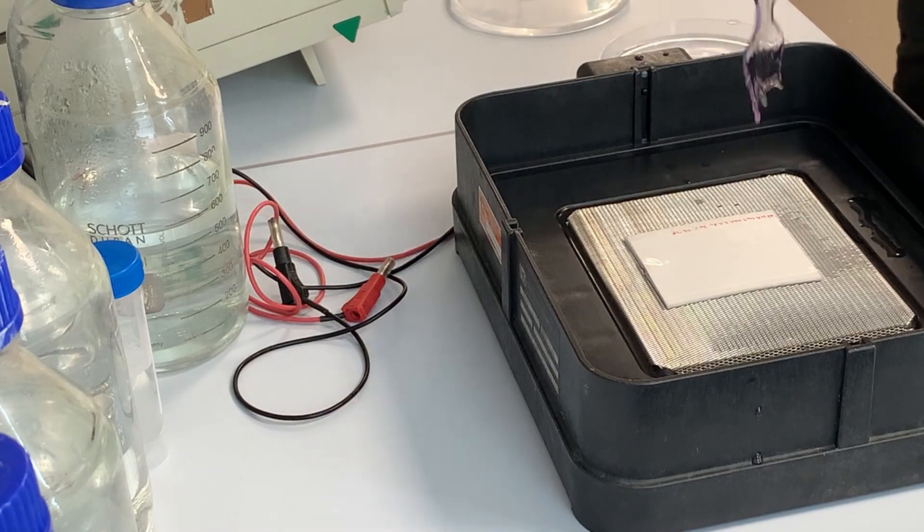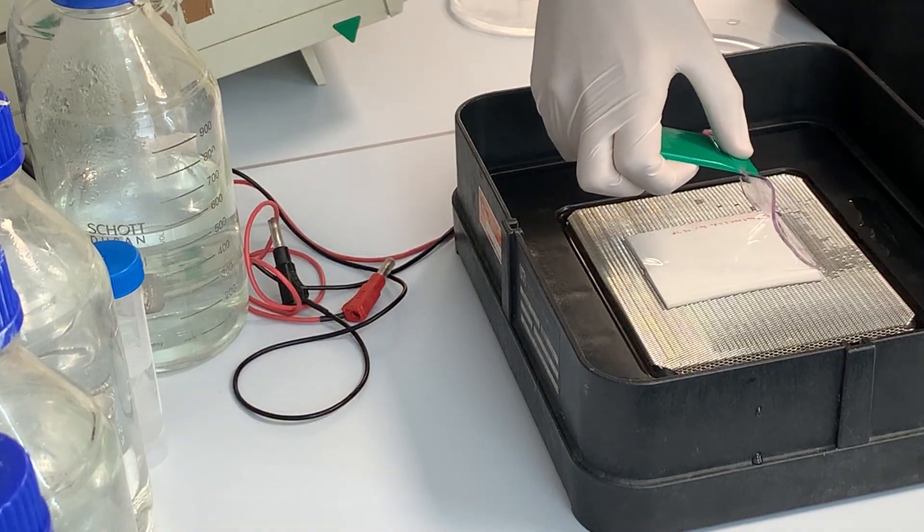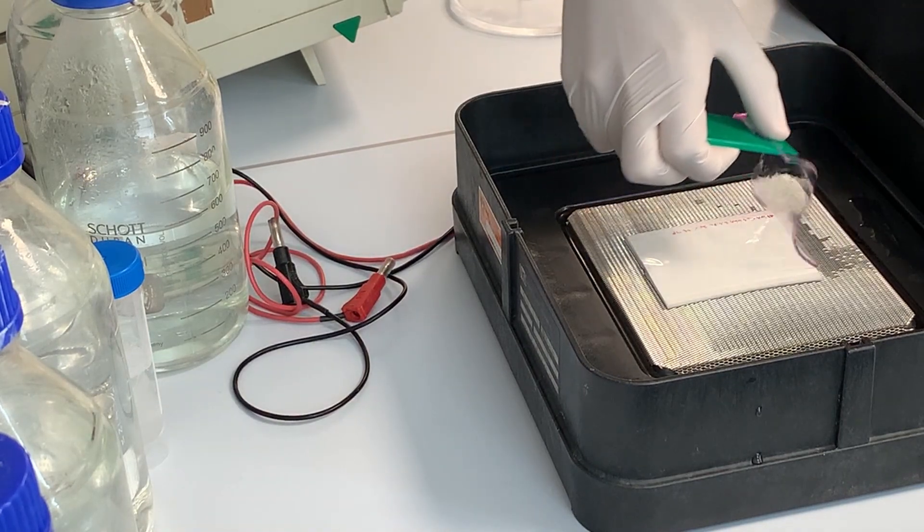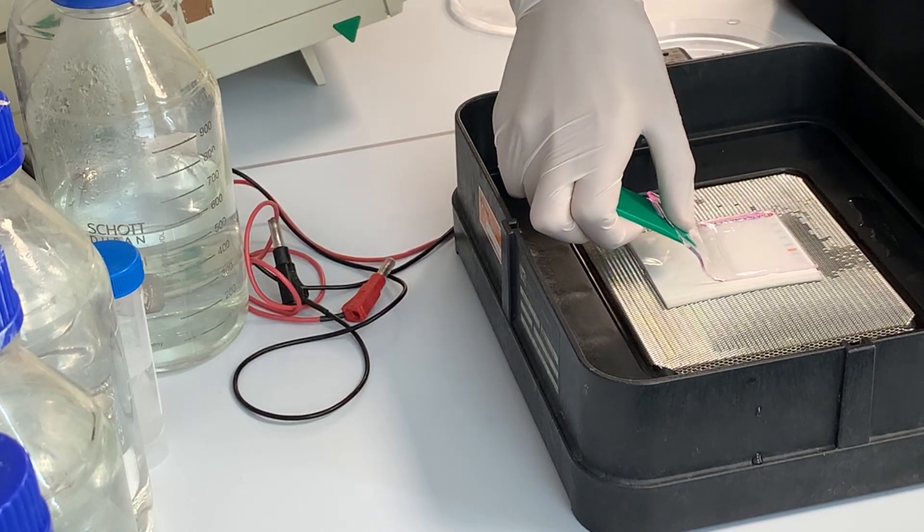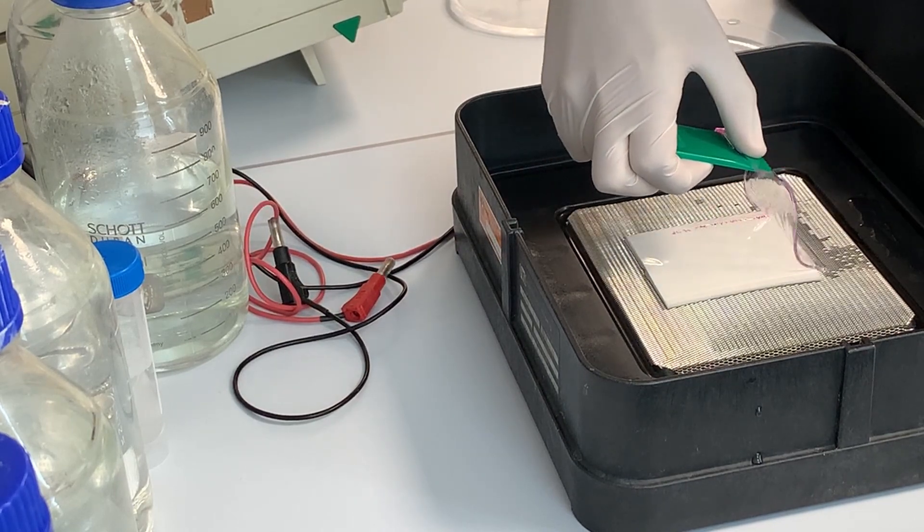Next I place the gel on the sandwich. Again make sure that no air bubbles form. You can wipe them off with a pre-wetted spatula. But do it very gently, don't scratch the membrane.